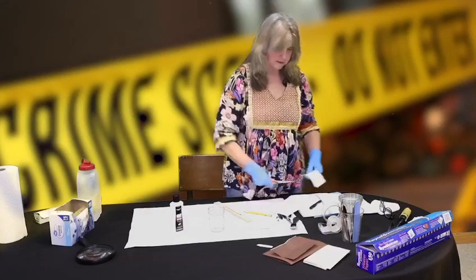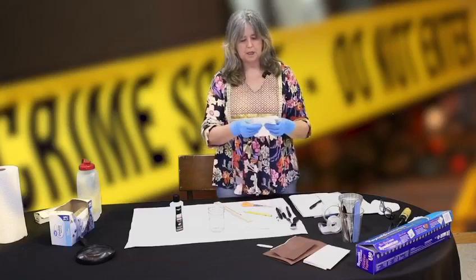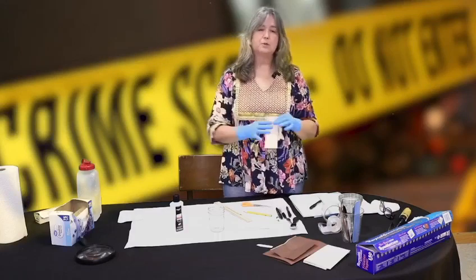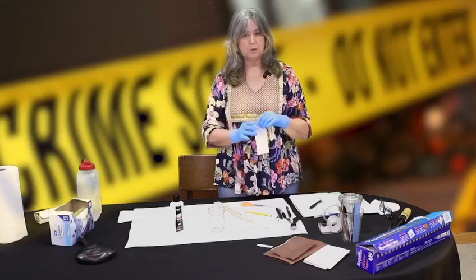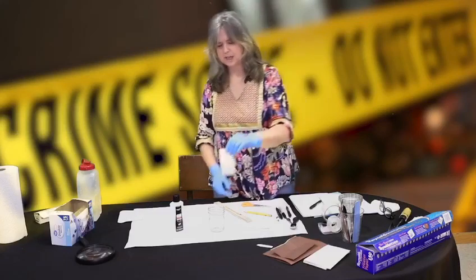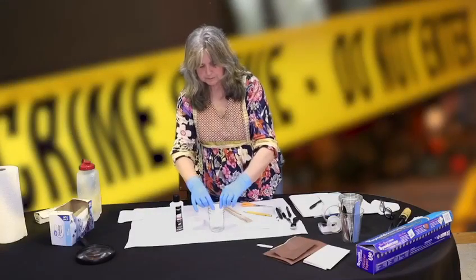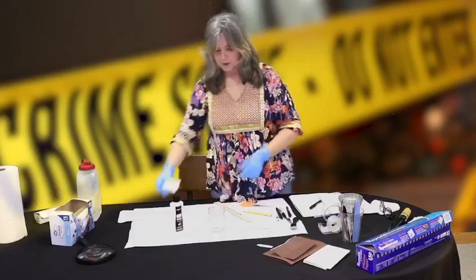Is there a reason why the glass is glass and not clear plastic or metal? You wouldn't want to use plastic just in case the acetone dissolved it, because acetone will dissolve plastic. If you want to try it with watercolor magic markers and just water, then you could use a clear plastic cup — that would be fine. But if you're using acetone, stick with glass. If you don't have coffee filters and want to try it with a paper towel, leave enough of the paper towel so you can fold it over the edge of your cup. Our papers are ready.